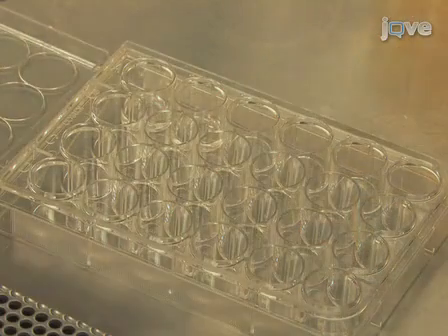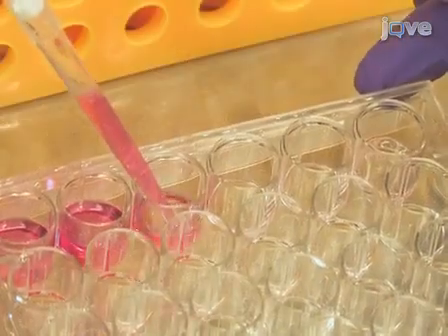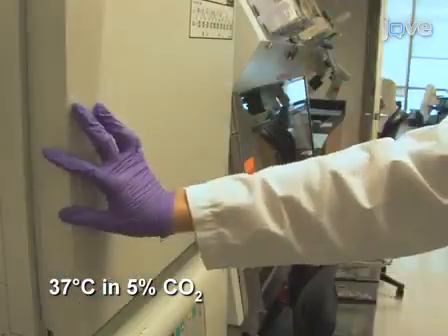Remove the antibody solution from the activation plate. Rinse each well with sterile PBS. Add 1 milliliter of the cell suspension to each well and place the plate at 37 degrees Celsius, 5% carbon dioxide in a cell incubator.